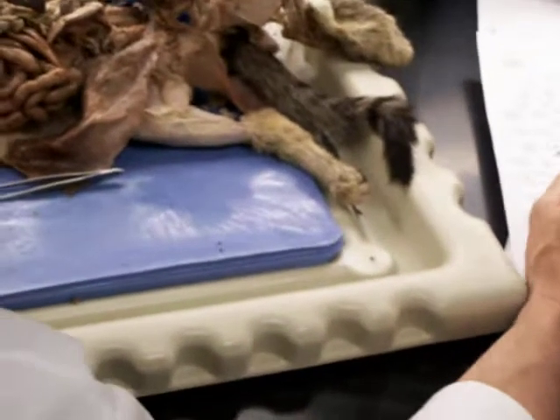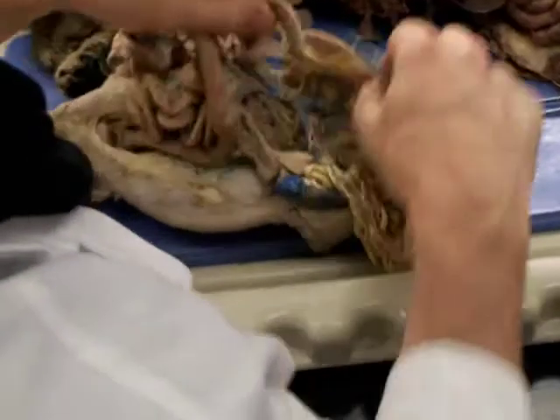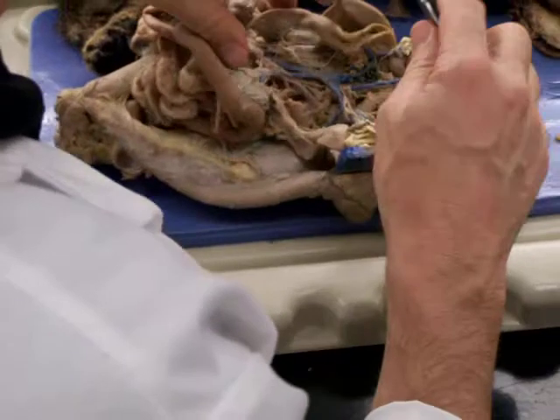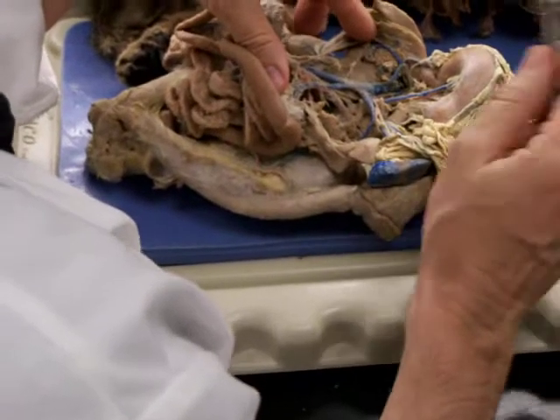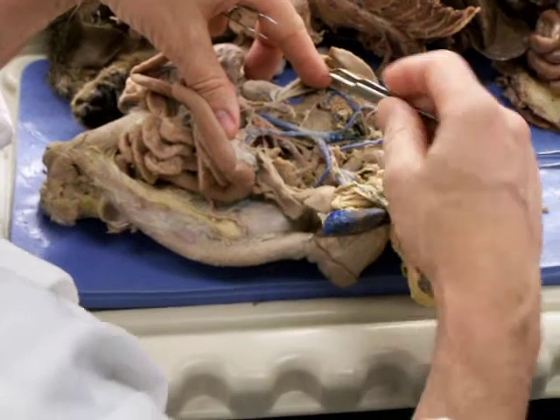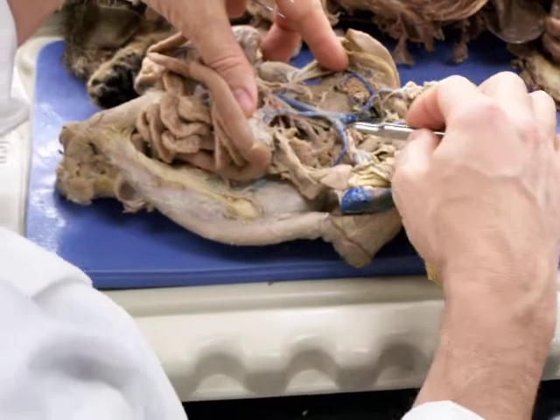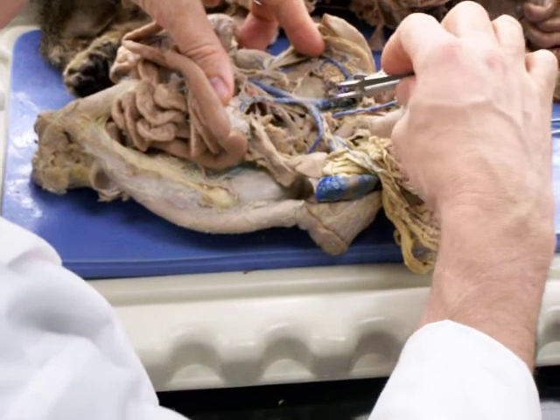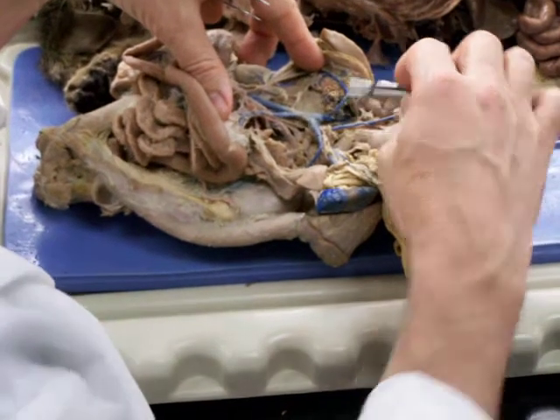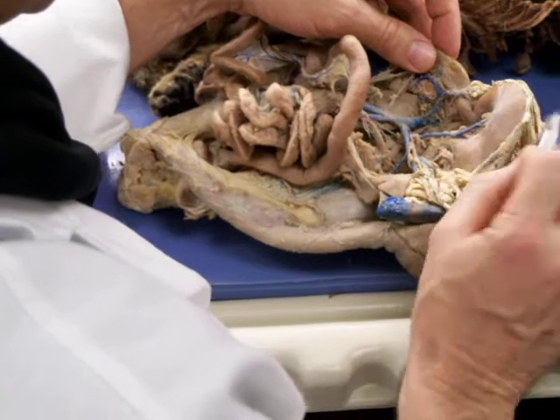Let me see if there's any of these others that I'm talking about. Well, we'll start with that. It gets kind of confusing because there's lots of branches that come into the hepatic portal. But the two branches I just mentioned, this is the lienogastric right here, and this is the cranial mesenteric vein. These two veins come together to form the hepatic portal vein. So from here on up to the liver, that's the hepatic portal vein.